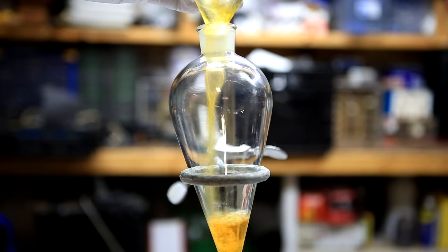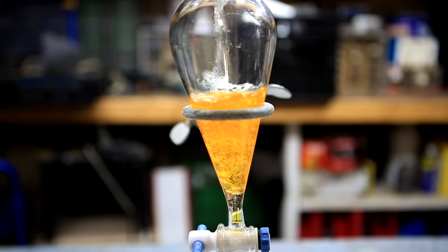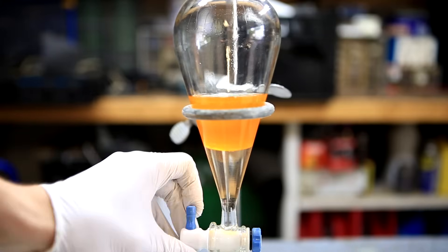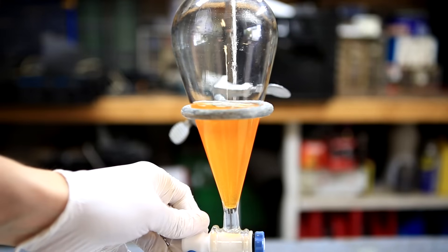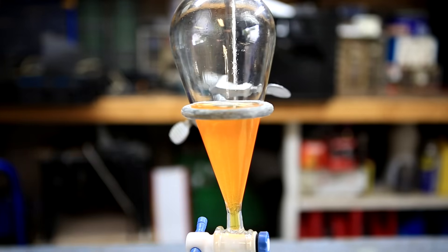The benzene was then transferred to a separatory funnel. The benzene was then washed twice with 20 milliliters of water. You'll actually probably notice that there was already a little layer before the water was added, and this is due to the water that came over that was present in the sodium benzoate and the sodium hydroxide.